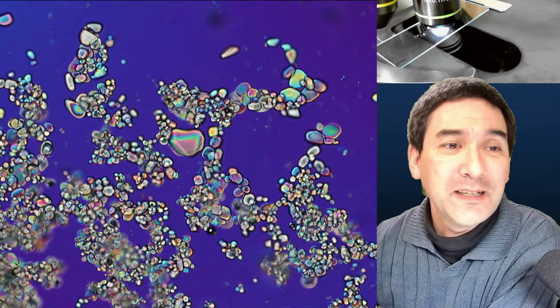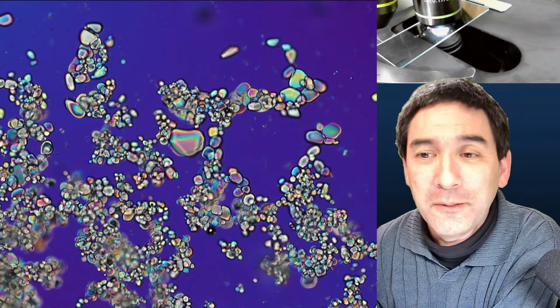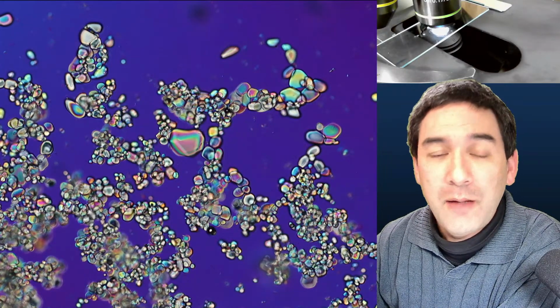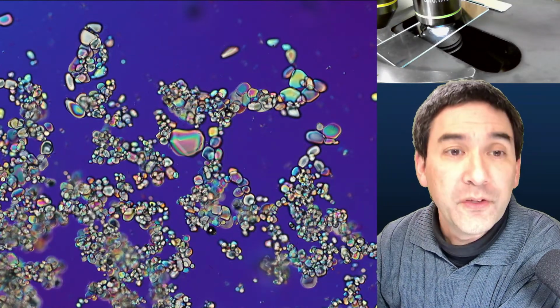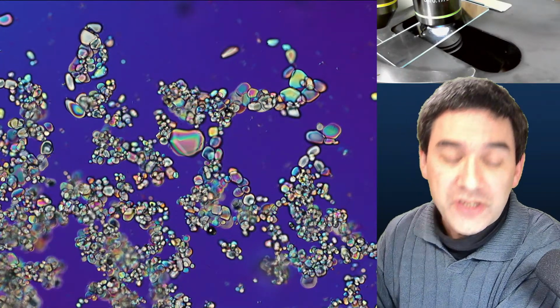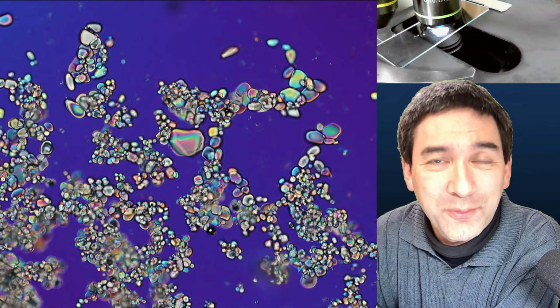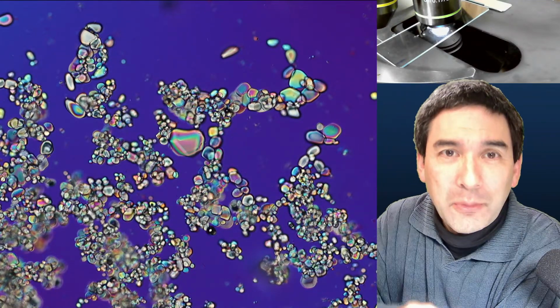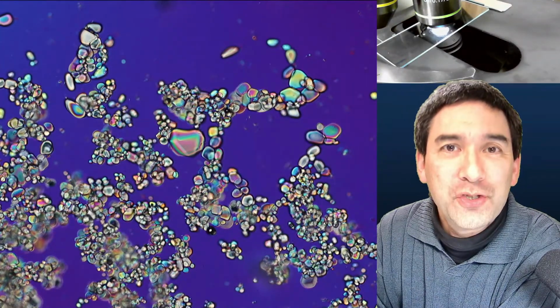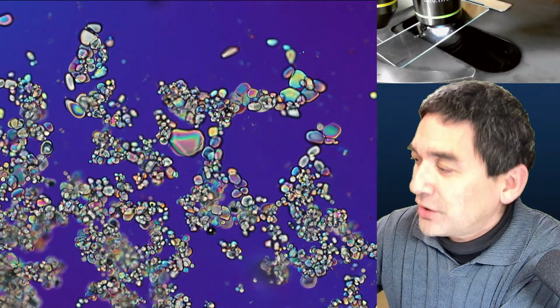Okay, so basically, these are some of the challenges that you might experience here. I would like to simply show you now some of the crystals, and I would like to also dissolve some of them again, because crystallizing them out will actually take a few hours, right? And of course, we don't have that time, so I'm going to try reverse crystallization. Basically, I'm going to add a little bit of solvent, and then you can see how some of those crystals start to dissolve again.